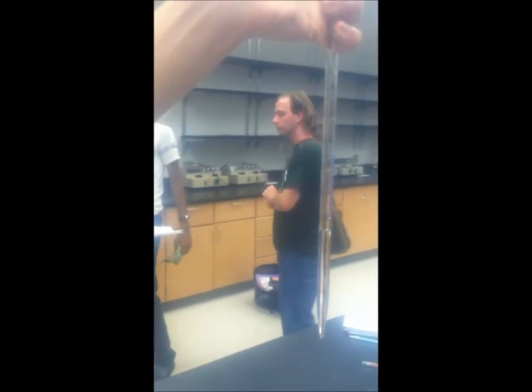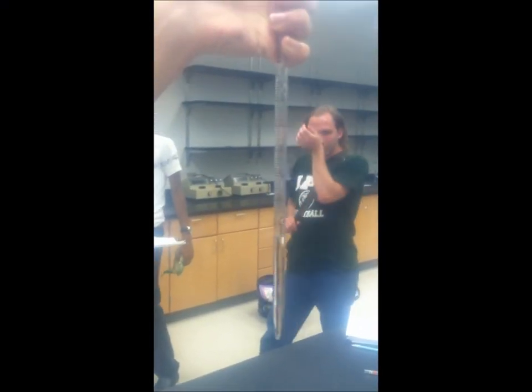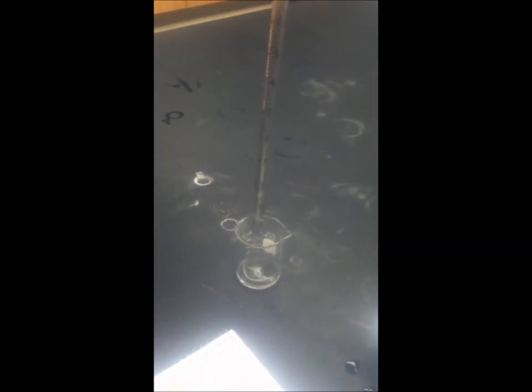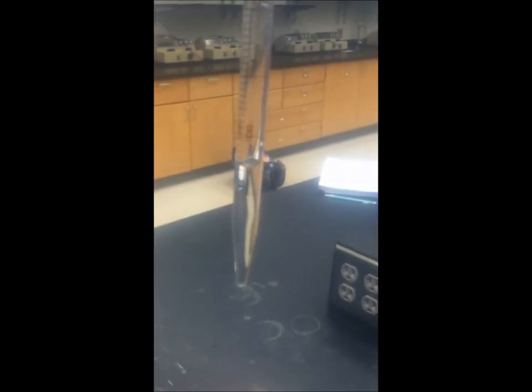As soon as he gets his first measurement, he will then record that measurement in the initial volume category of his chart. After recording his first measurement of volume, Stephen will empty an unknown amount of water into the second beaker and then get his second measurement from the pipette.